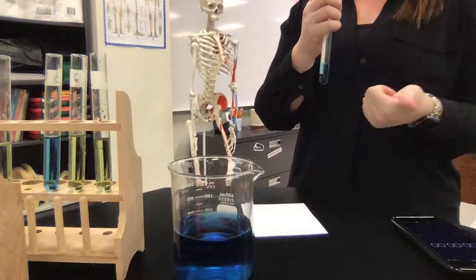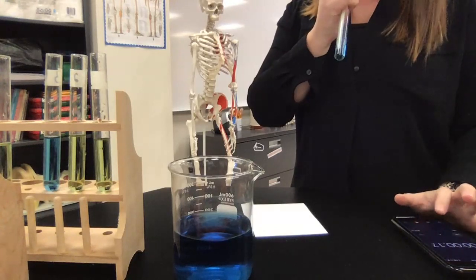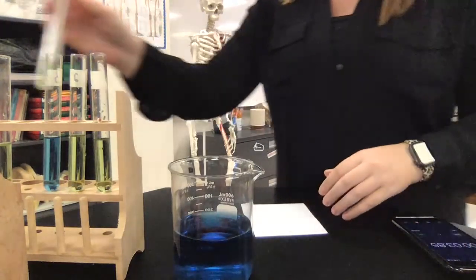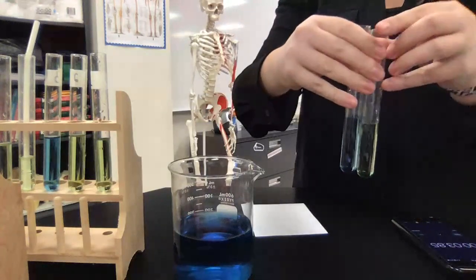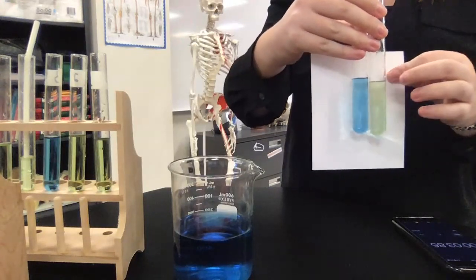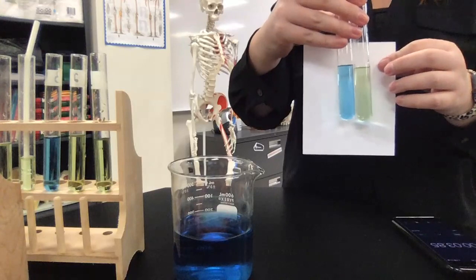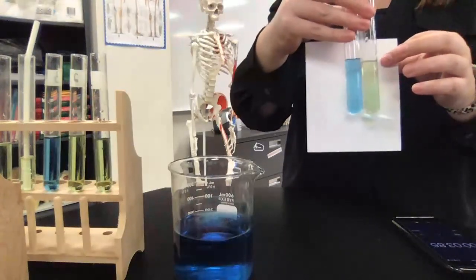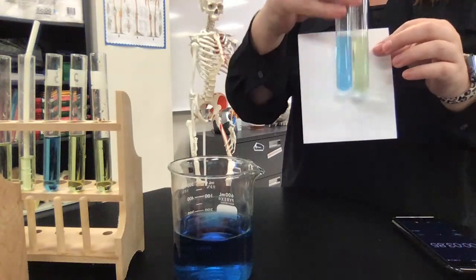So after two minutes, you'd get your heart rate — beats per minute — and your breaths per minute, and now we're going to do this color change again. It took about 3.8 seconds. Here's the comparison for the color: we have bromothymol blue in the presence of just oxygen in its natural state — it's going to be blue, that's why it got its name. And then in the second tube, we have a lot of carbonic acid being created as your carbon dioxide mixes with the water in the tube. Bromothymol blue is a powder mixed with water, so in the presence of the carbonic acid, it turns this greenish-yellowish color as the pH changes. So you can see a nice little comparison there.